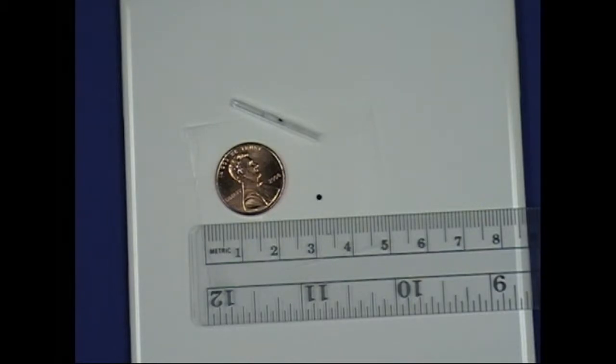One microliter of water is a milligram, and that's about 10 times as much sample as we want.